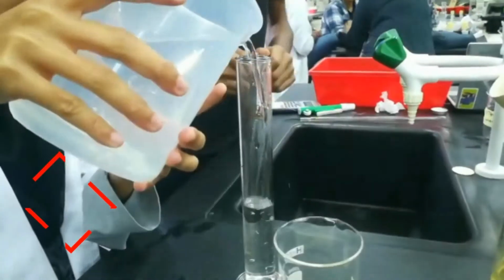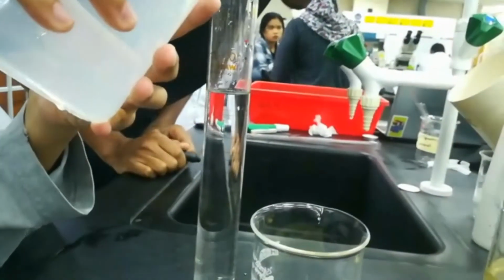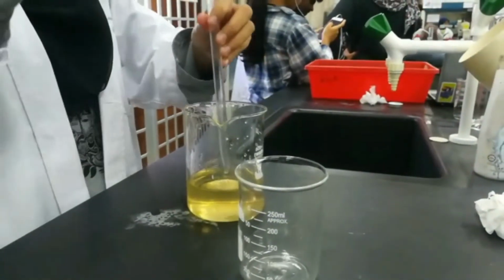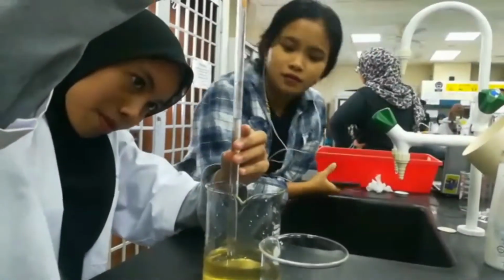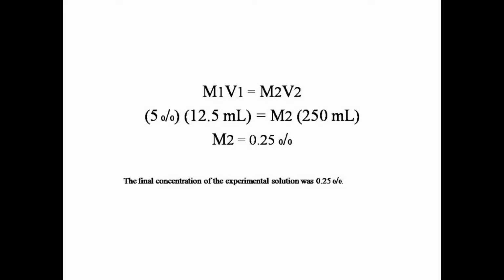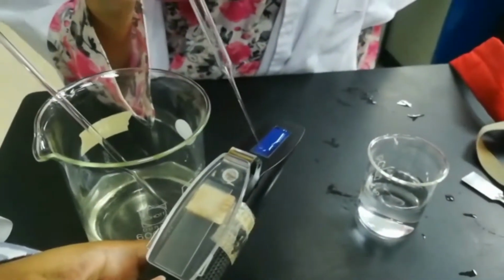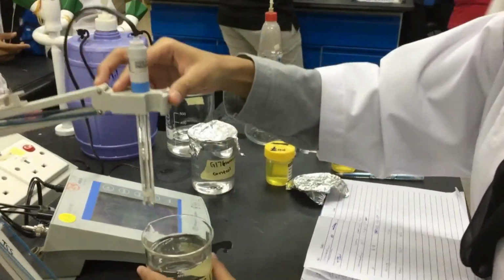Next, preparation of the solution. Two beakers of 250 ml were prepared for both dechlorinated water and bird nest water. The bird nest water was diluted by using only 12.5 ml and mixed with distilled water until it reached the total volume of 250 ml. The concentration of the experimental solution was determined by using the following formula. The parameters such as salinity and pH of both control and experimental solution were determined using a refractometer, pH meter, and Hydrolab Quanta.